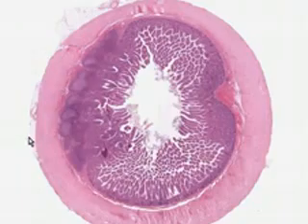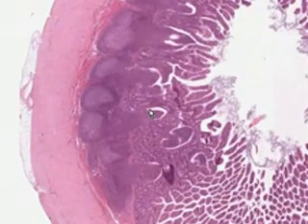So if you look closely, you may see some mesothelial cell linings on the surface, which I hope we will see. Otherwise, let's review the classical layers, and it really doesn't matter where we start. Also, I don't think it's really that important that we differentiate histologically between ileum and jejunum. Let's just say there are a few subtle differences.